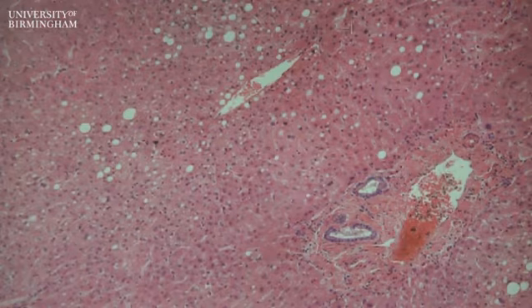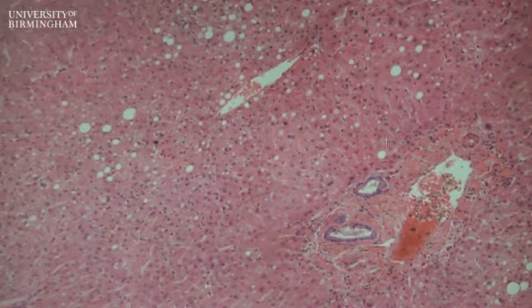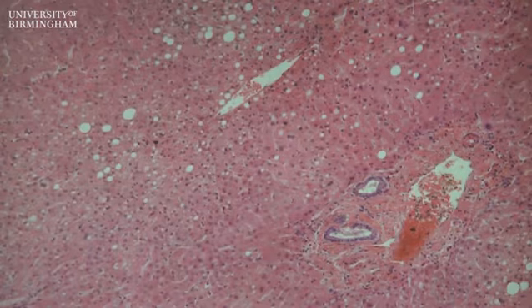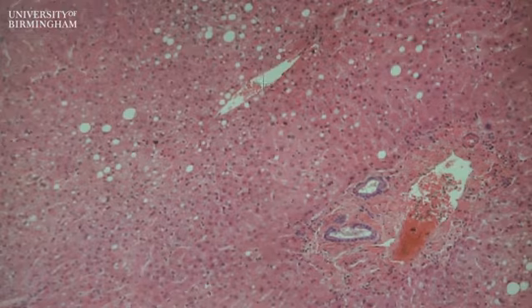The other landmark to point out as part of the normal liver microanatomy, or the lobule, is the small branch here of the hepatic vein, and essentially the blood from the hepatic artery and the portal vein flows in between liver cells in tiny channels known as sinusoids, which you can barely see here. There's occasional slit-like spaces here which are the sinusoids, before moving into the hepatic vein, and then this drains into larger and larger branches of the hepatic vein, eventually into the vena cava, and then into the right side of the heart.